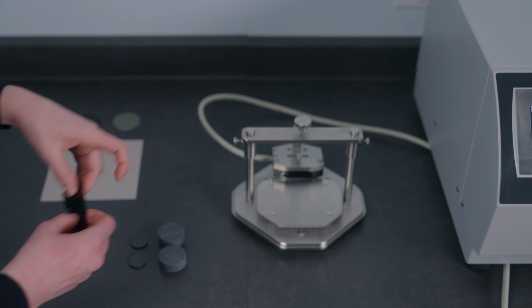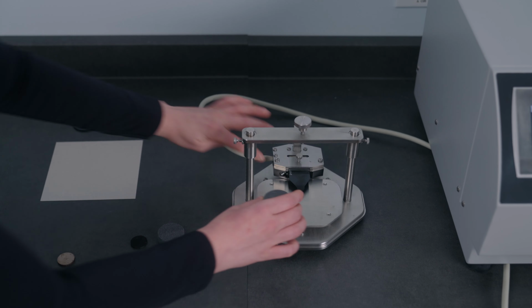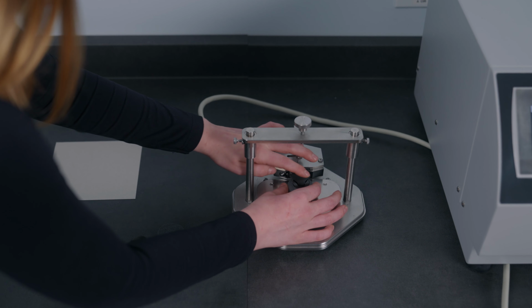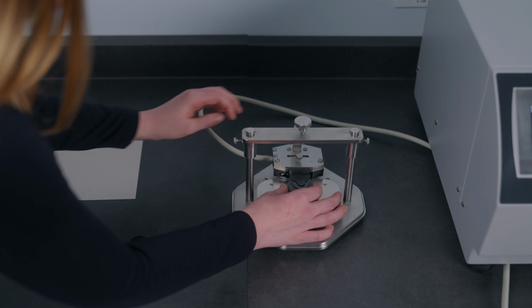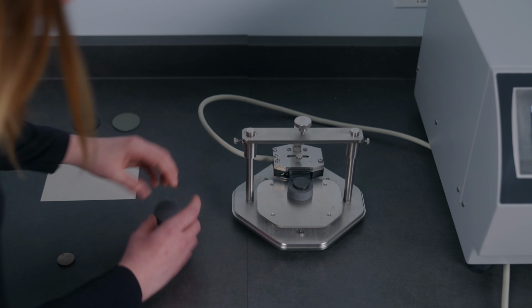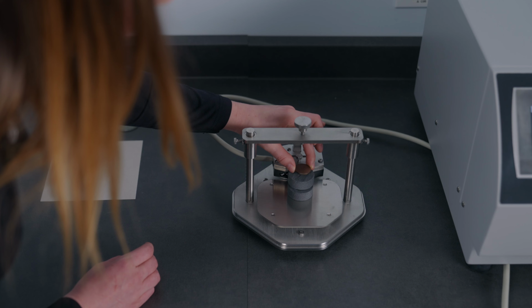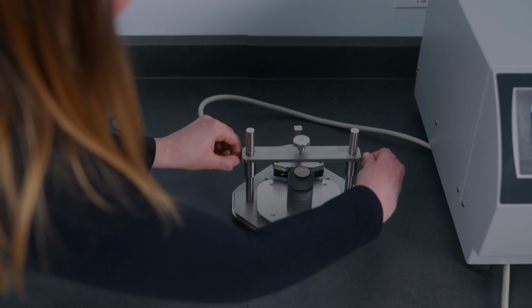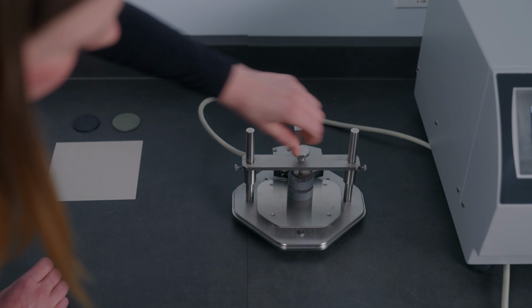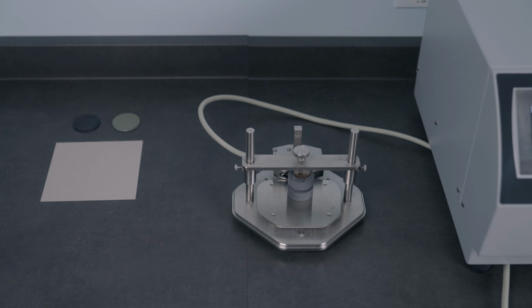So we're going to connect our TPS sensor to our stand, place a foam on either side of the sample to enforce the boundary condition, and do the exact same thing for a symmetric setup. Then we're just going to place our protective disc, protect the top sample, and clamp it all together, create good contact between the sample and the sensor. Now we can just move over to the software and set up the measurement.